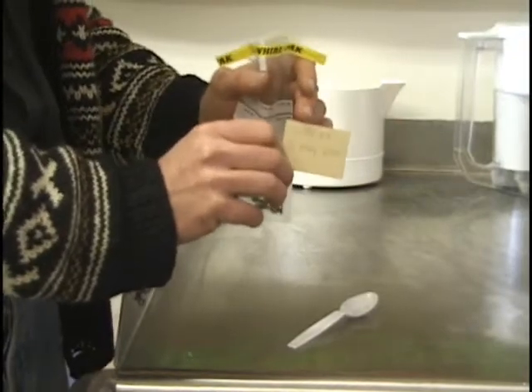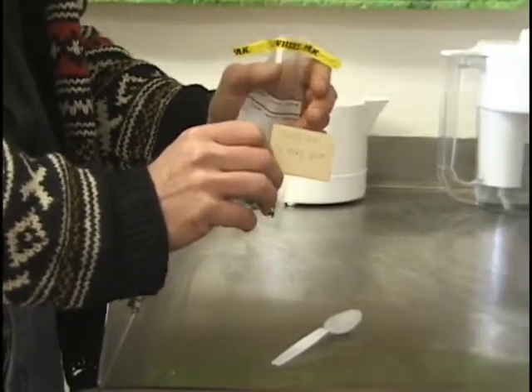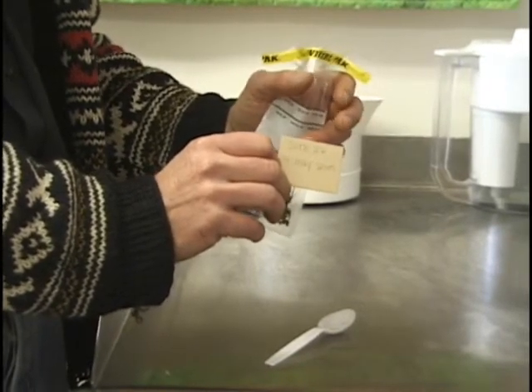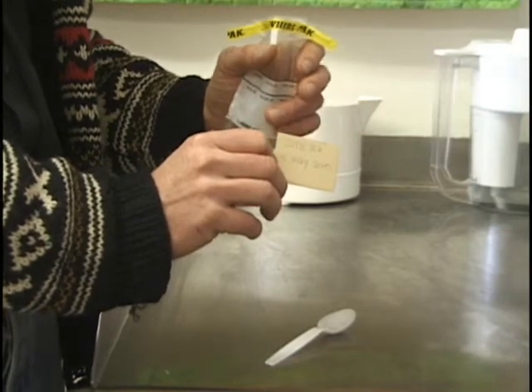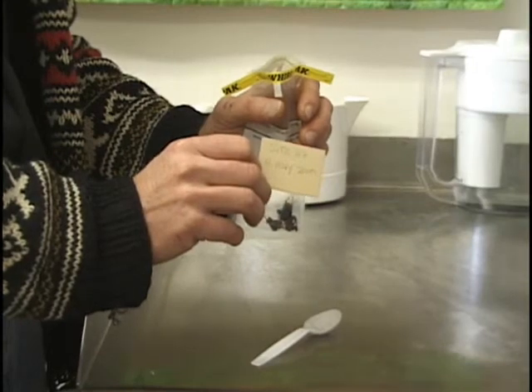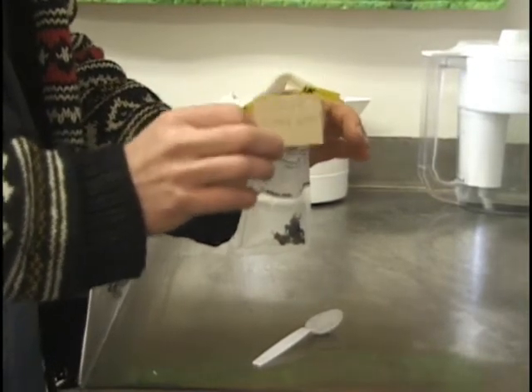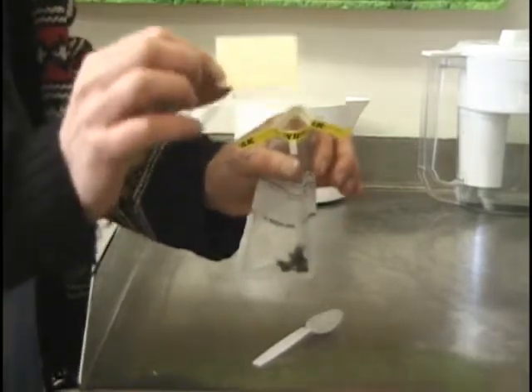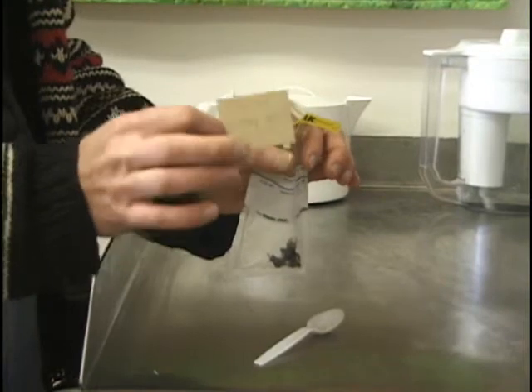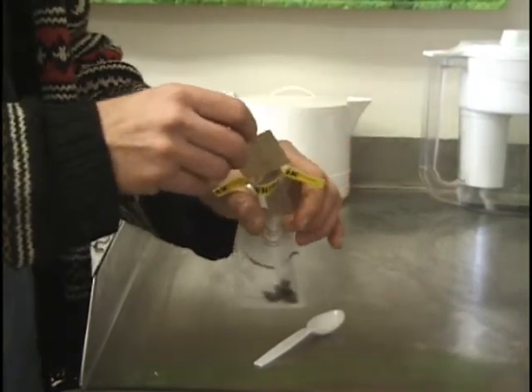The site label has the site number and the date. Note that the date is always written so that the month is spelled out or uses Roman numerals, and the year and day of the month are in regular numbers — that way we don't get confused about what the month is and what the day is. It's always written in pencil, because even technical pens sometimes run.